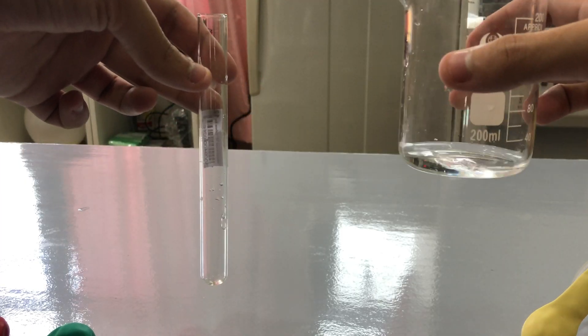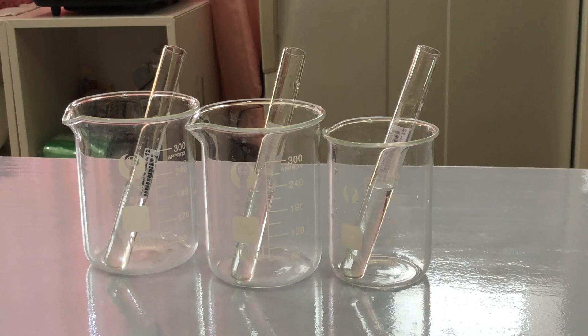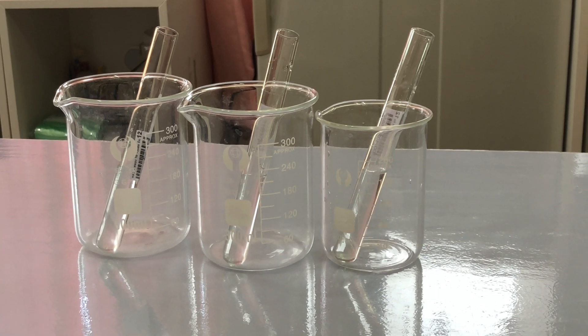First step, we will prepare about 10 ml of acetic acid in a test tube and put the same amount in three test tubes.